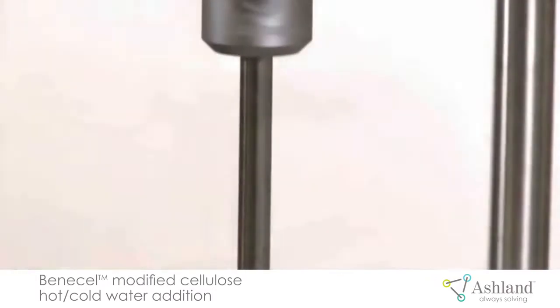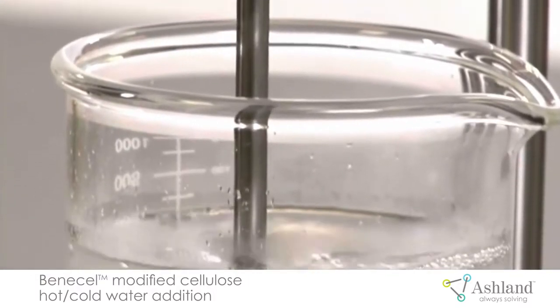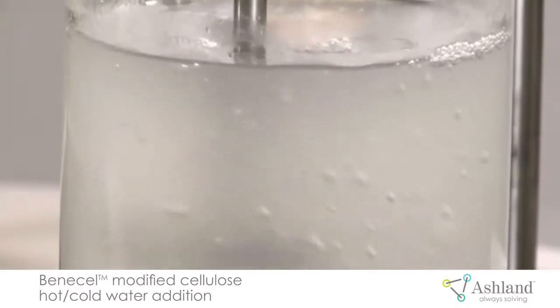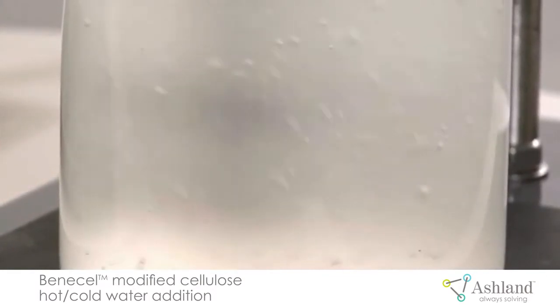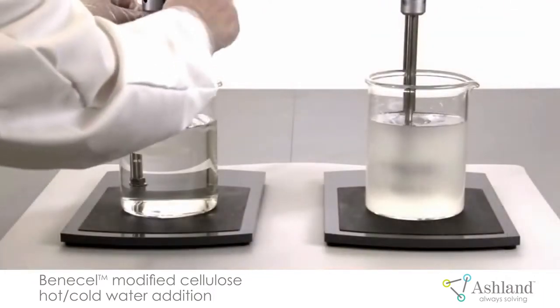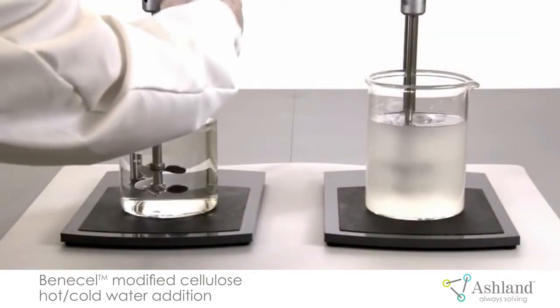As it cools, it will become clearer as the Benecel modified cellulose begins to hydrate. Modified cellulose solutions tend to entrain air if they are mixed too vigorously, which can cause them to foam. That tendency can be minimized by reducing the speed of the mixer.